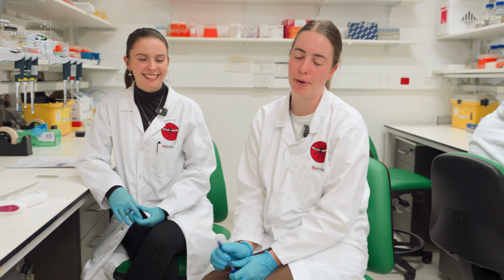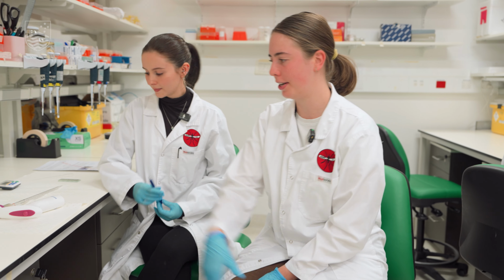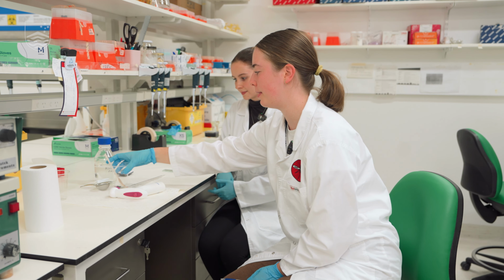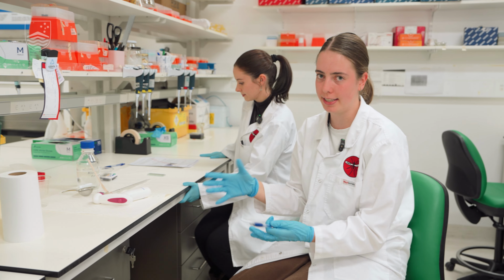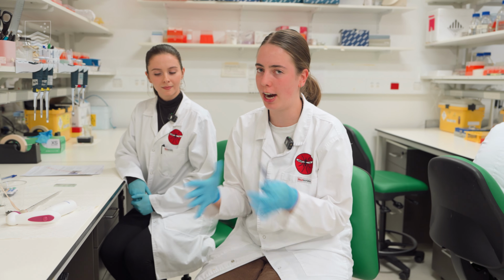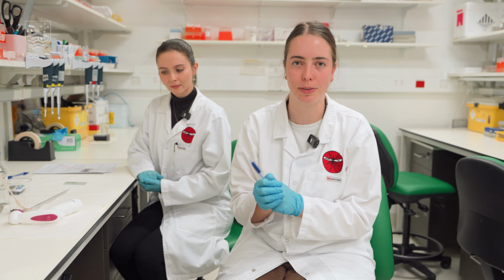Essentially, we've been working with a local wombat rescue group to try and establish a threshold for parasitic infection that will inform their treatment plans. So we've got a sample here of some fresh wombat poo, and we're going to mix it with a special solution that makes the parasitic eggs float to the top, and then we can have a look under the microscope and try and determine how many parasites this wombat has.